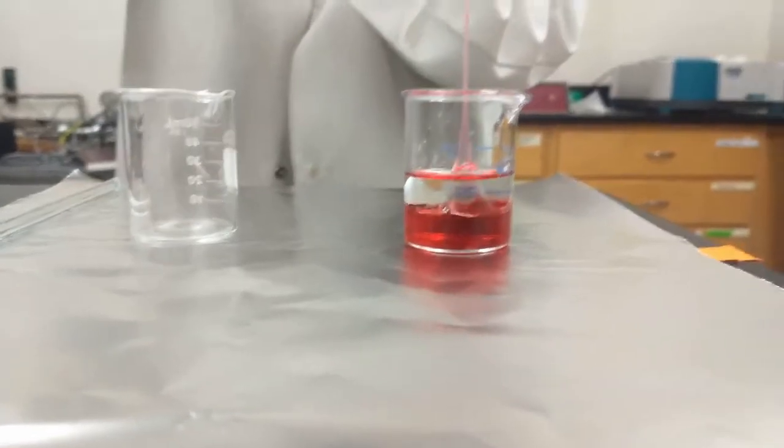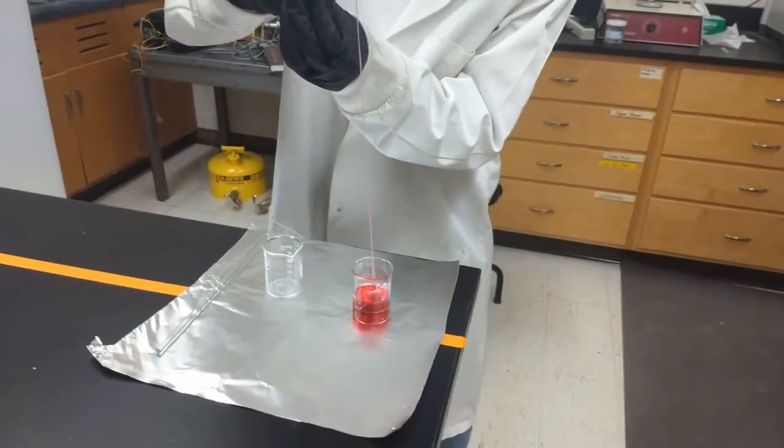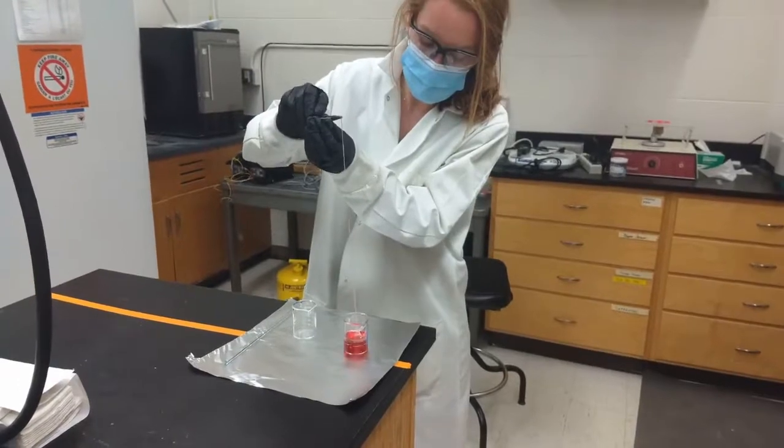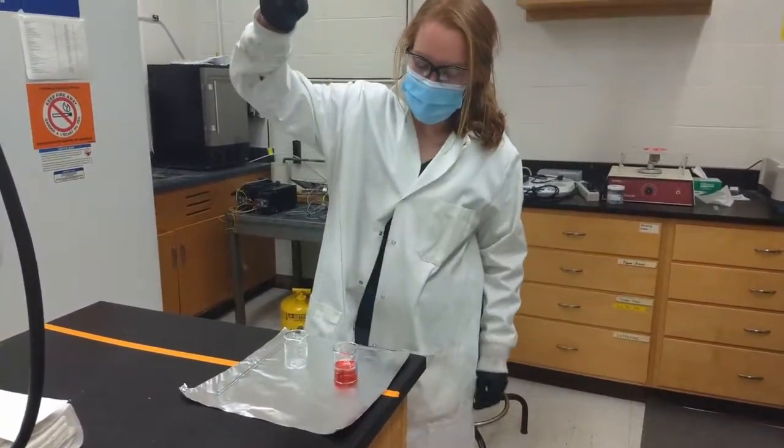As I pull the nylon up, more and more of the monomers are allowed to come into contact with each other at the interface to continuously form more polymer as I continue to pull up more nylon.